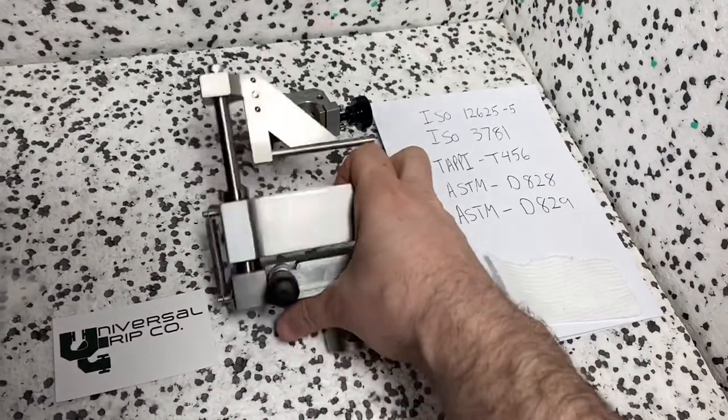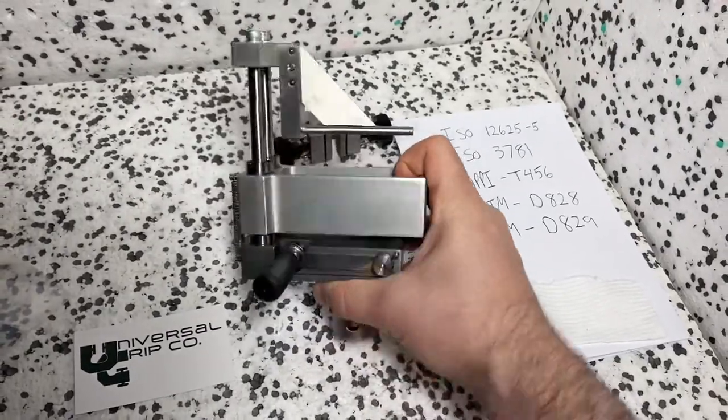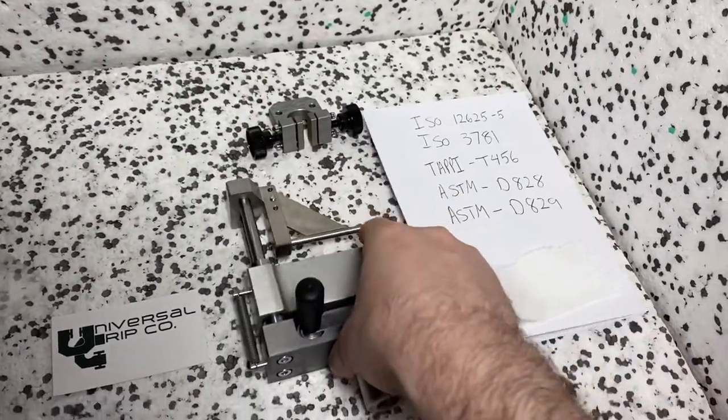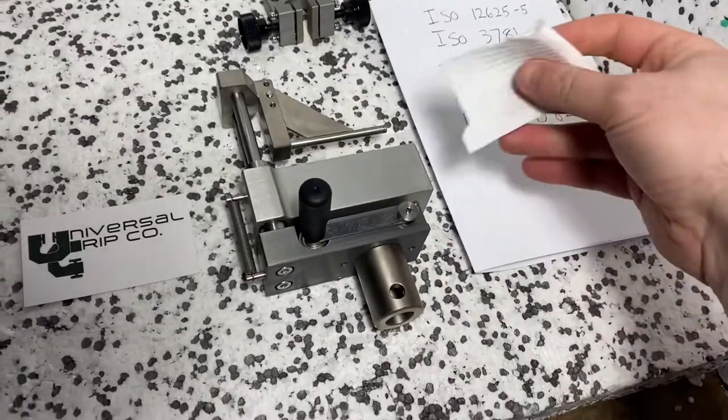You would mount this on the machine on the bottom like this with our standard adapter and then we have a little bit of sample here.